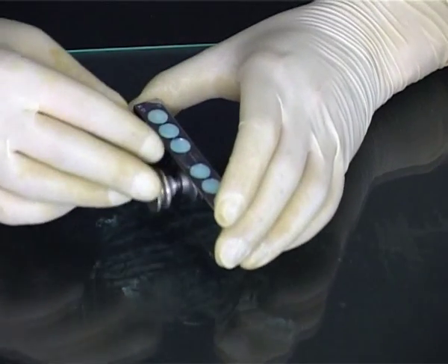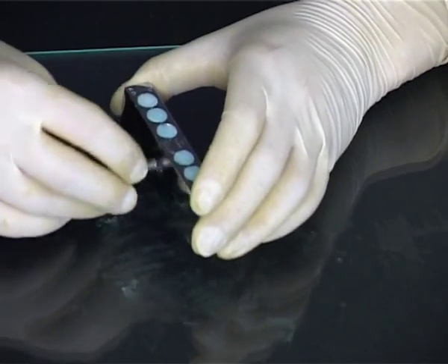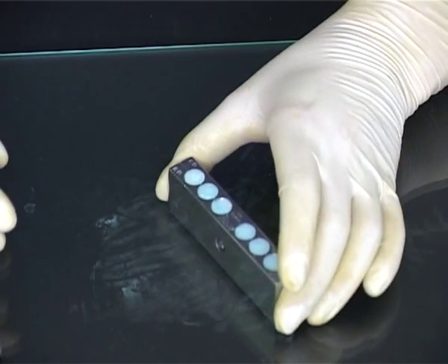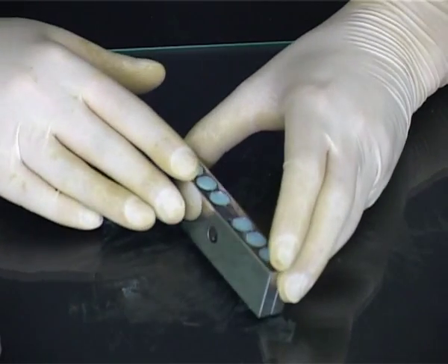Remove the suppositories carefully. Do not attempt this until the suppositories have completely set.